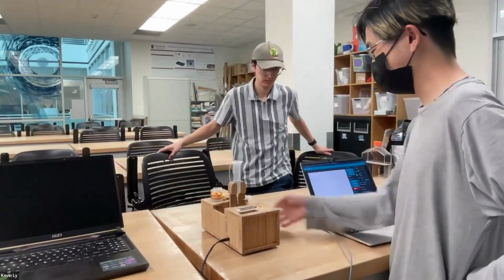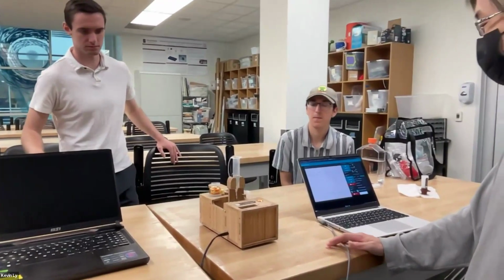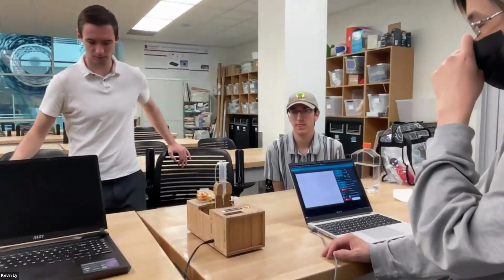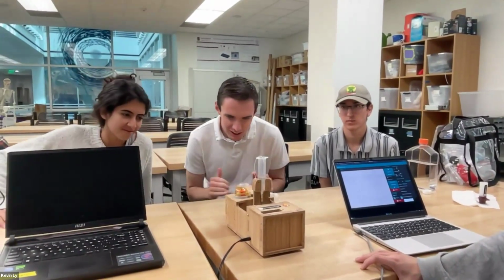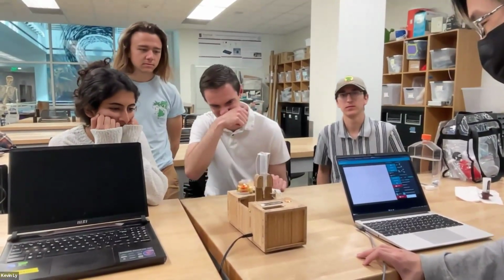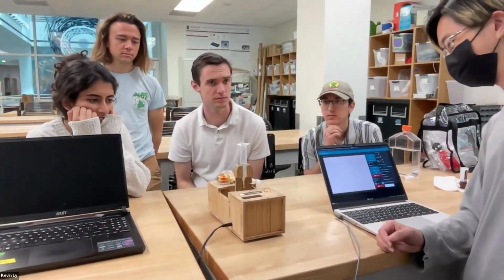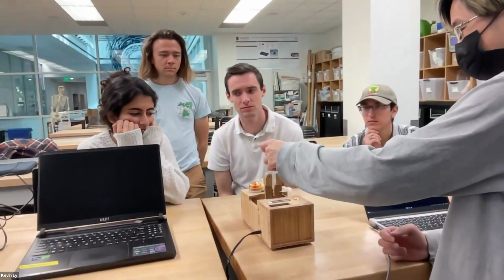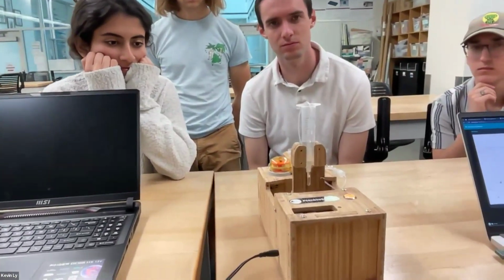So the idea is this is a low-cost microscope that's aimed at providing similar capabilities as existing microscopes, which cost closer to $10,000 or $100,000. But this is several hundred to a few $1,000s. So basically we have a water sample with plankton inside or microplastics or other suspended things.